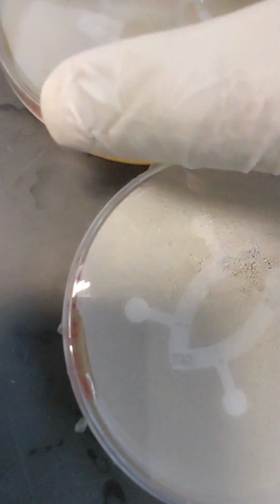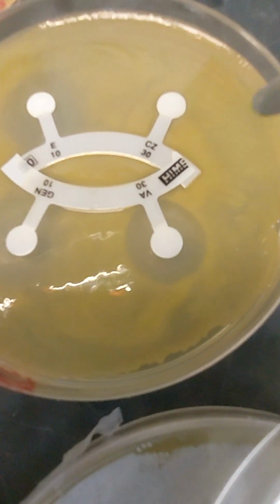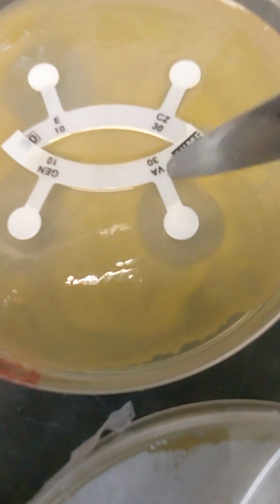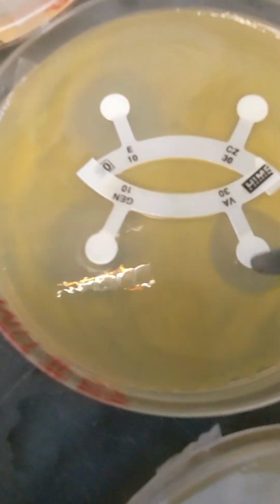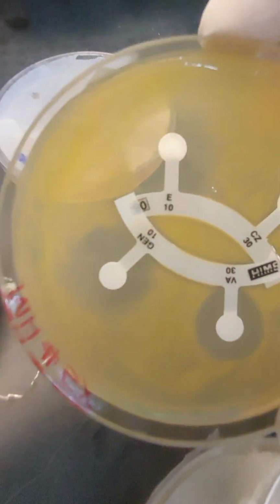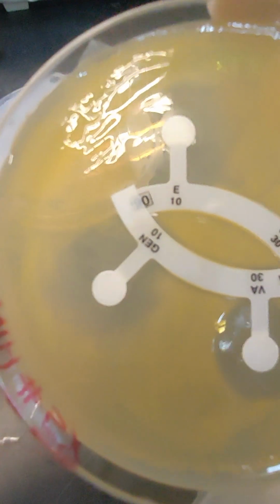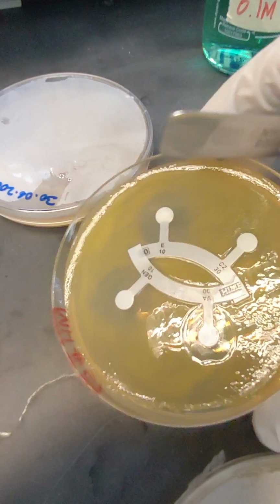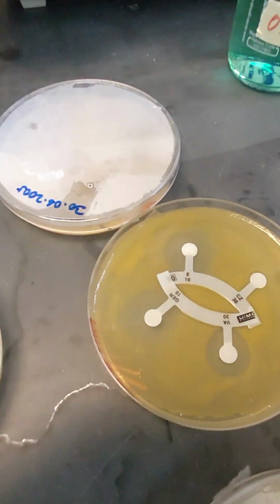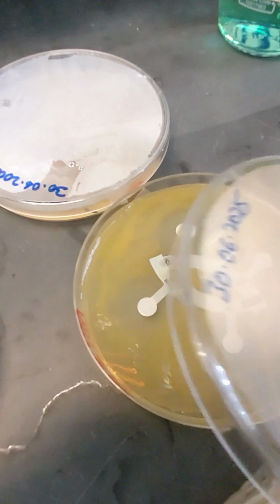Then we look at the next one, which is 5Y, but with a different antibiotic. And then you can see here, look, and this is VA, which is vancomycin. So vancomycin can inhibit this particular microbe. The rest, let me look closely. So you see gentamicin, and we have E. So I'll check these codes later, and we can see that these antibiotics are working and they are reducing or inhibiting the growth of this particular bacterium.